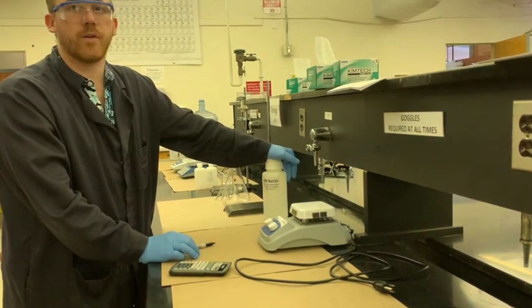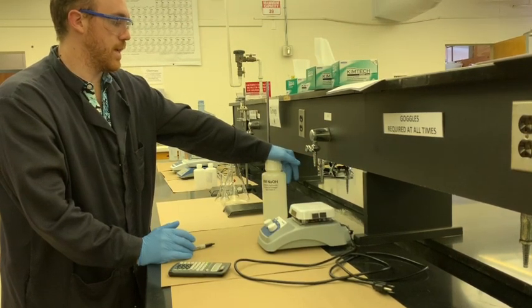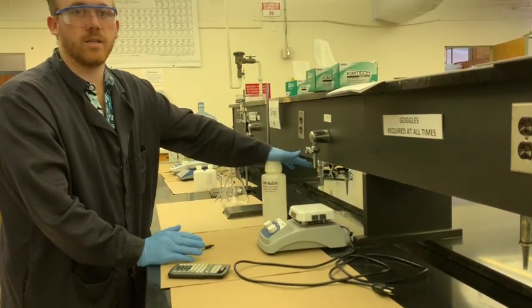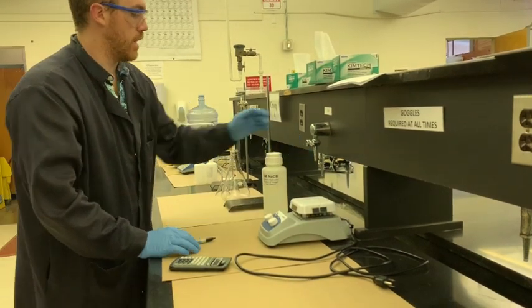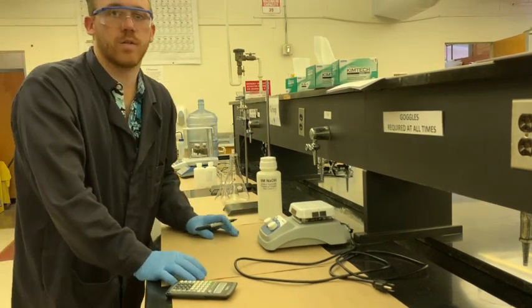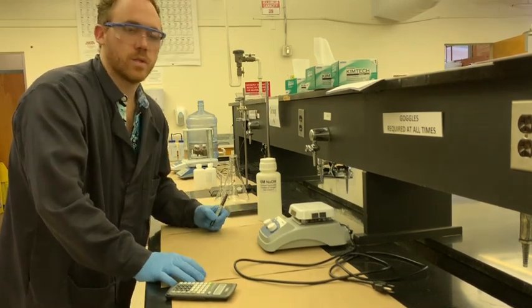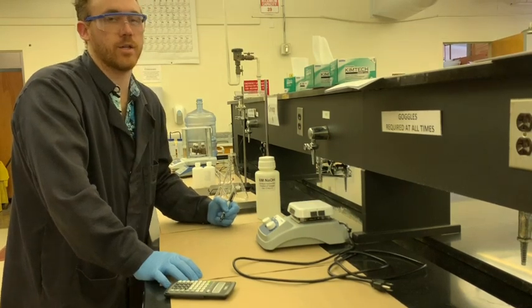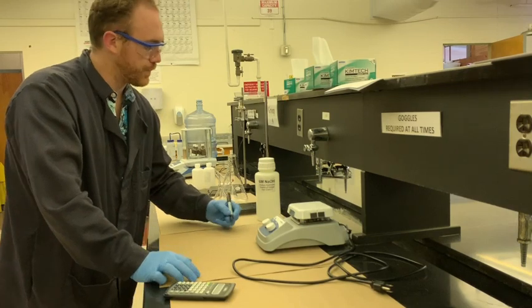First thing we've got to do is figure out, to get to the right concentration of NaOH, which is definitely going to be less concentrated than 6 molar, how much of the NaOH we're going to need to get what we want. So first we're going to take the 6 molar NaOH and dilute it to 0.250 molar NaOH. The way that we'll do that is we'll use the classic MV equals MV calculation, or M1V1 equals M2V2, in order to dilute the solution.